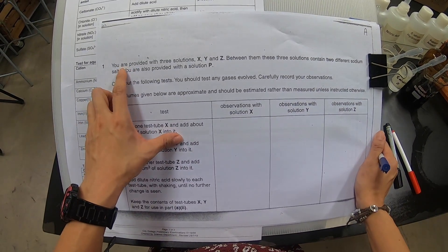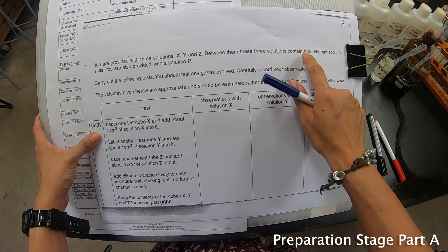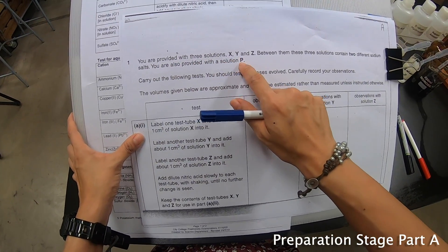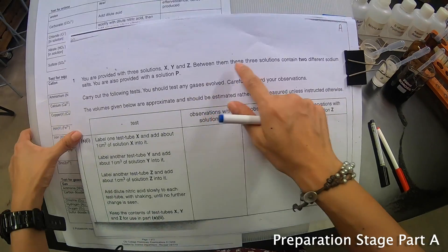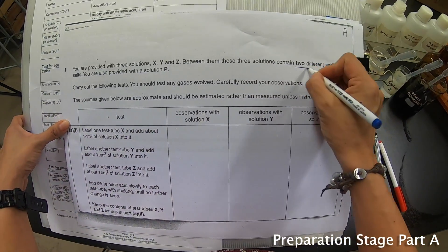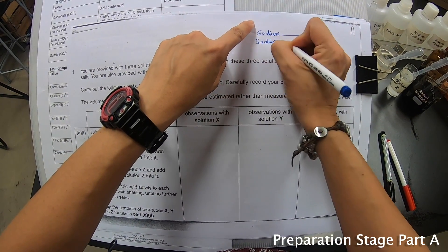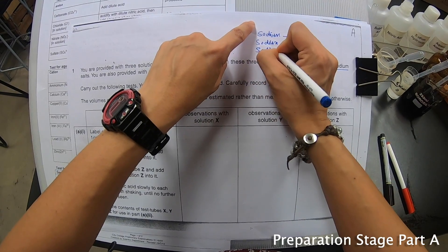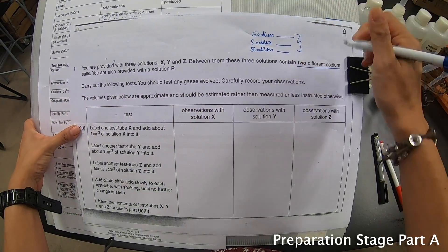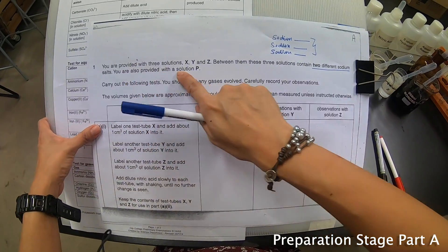The question says: you are provided with three solutions X, Y, and Z, and between them, these three solutions contain two different sodium salts. You are also provided with a solution P. Between X, Y, and Z, there are two different sodium salts — sodium something, sodium something, and sodium something — because there are three salts total. But out of these three, two of them will be repeated.